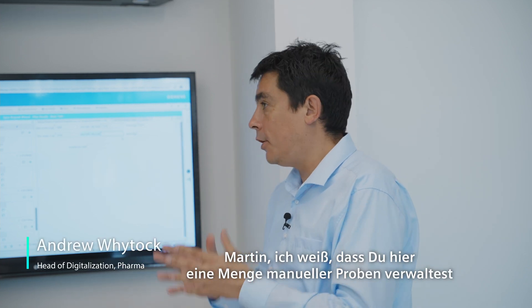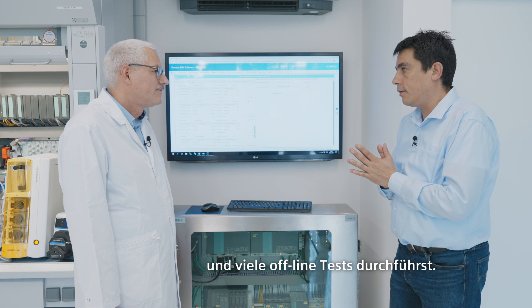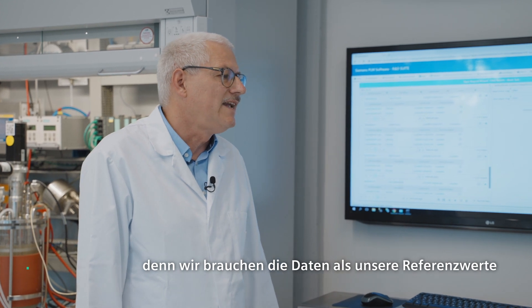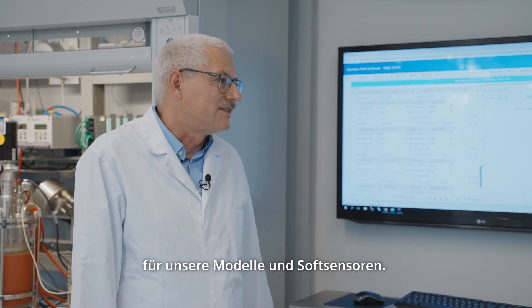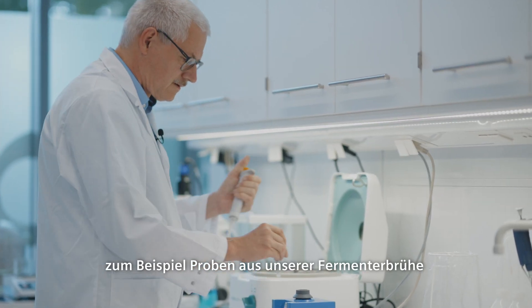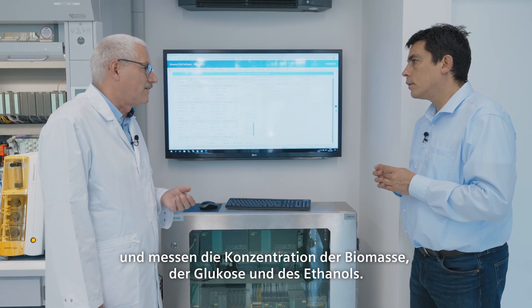Martin, I know you're managing a lot of manual samples here and doing a lot of offline testing. Can you explain how you're doing that? Yes, offline sampling is very important for us because we need the data for our ground truth for our models and soft sensors. For example, for our living lab process, we take samples from our fermenter broth and measure the concentration of the biomass, glucose, and ethanol.